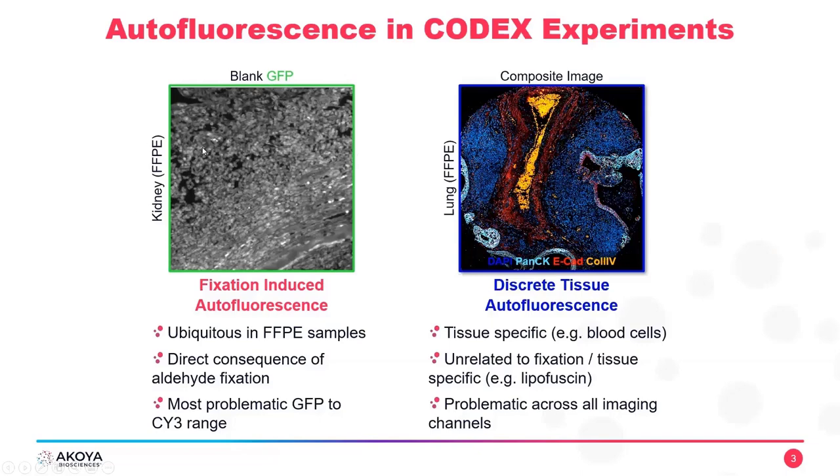So you can see there's all kinds of detail going on in this image. You can see cells, you can see bright spots, potentially a vasculature object. None of this is actually labeled. This is just autofluorescence. So you can see there's a lot going on. You don't want any of this to be here. This is autofluorescence. It's something you don't want in your experiment. So fixation-induced autofluorescence is certainly a problem.